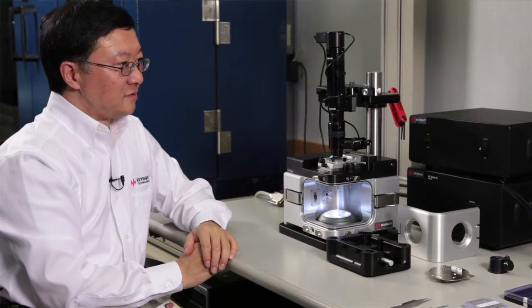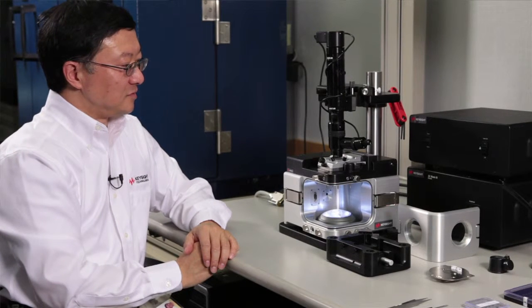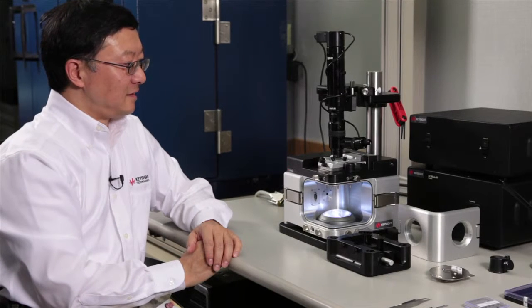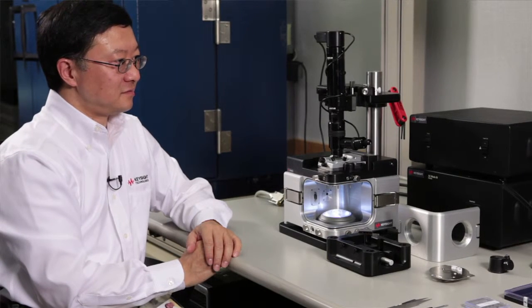Now, your 7500 AFM is all assembled and set up. The optical microscope is aligned and it's ready for the next operation.